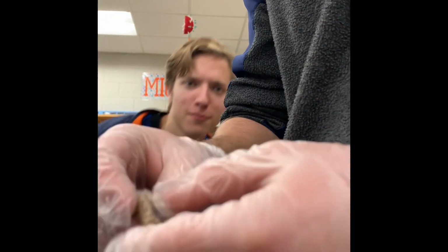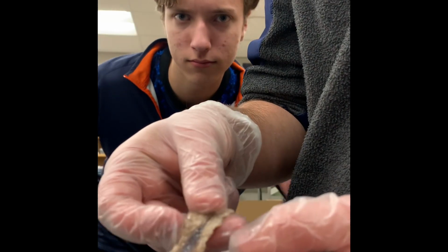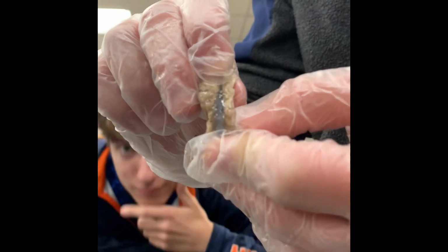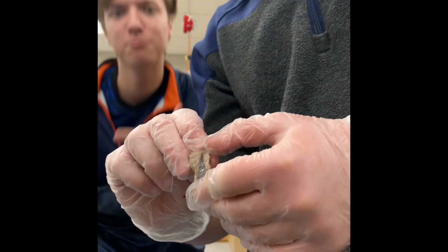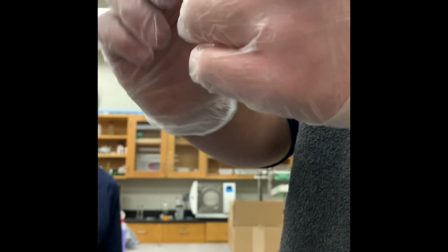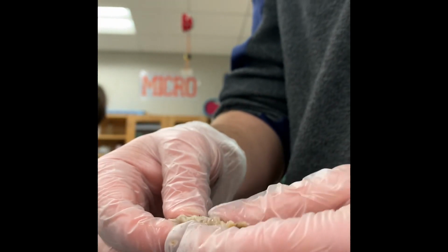Look, because you have this. We have this stuff right here. Synovial fluid or something. I don't know. Yeah, because you do the spinal tap. Spinal taps. Oh, that's good stuff right there. Honestly, if you wanted to, you could just take a big bite out of that. You can't tell that's a salamander. I think we got it.